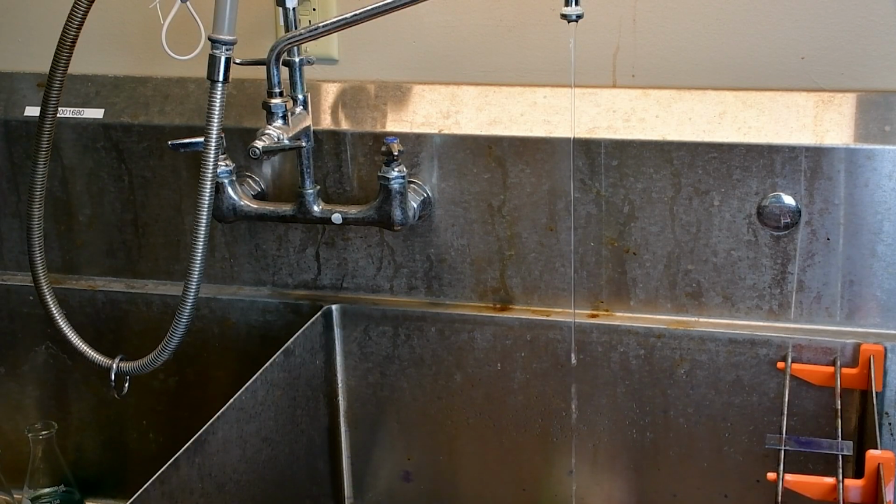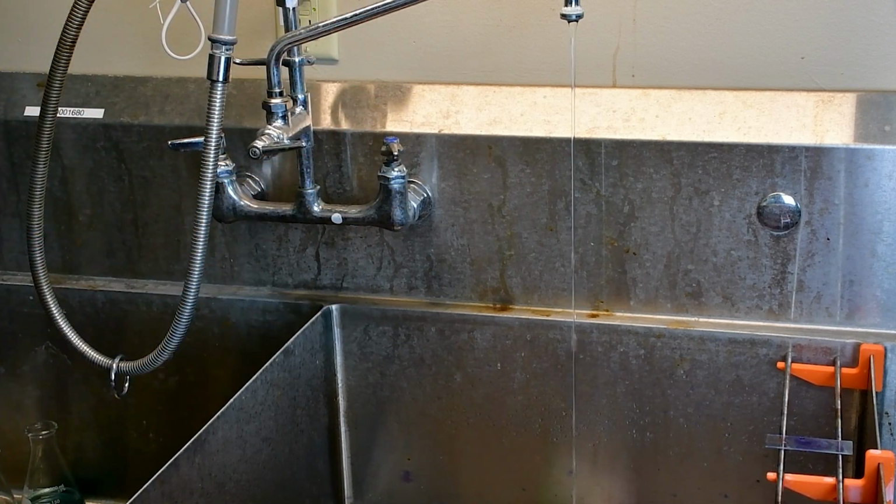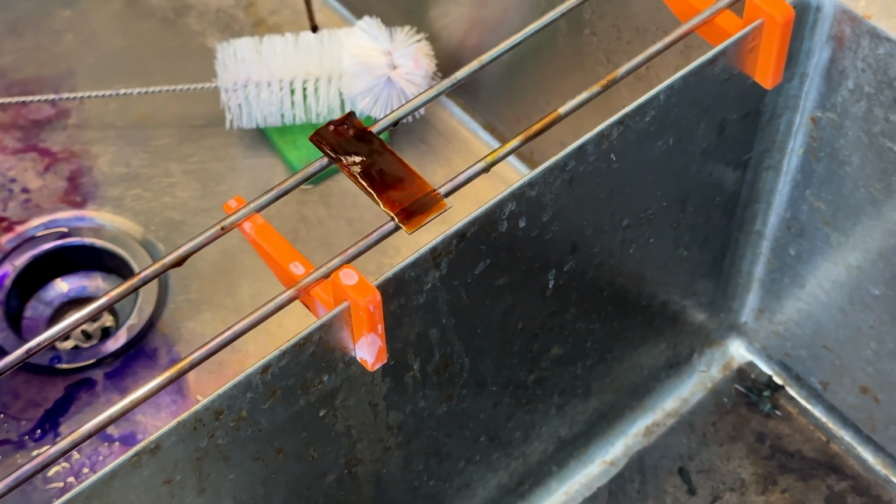Then I'm going to use the Neisser Stain 2. Now, you can purchase this. We prepare this in-house for our own use. It's fairly simple to make, but it's much simpler to just buy it in the full Neisser stain kit. I have a little bit that I've set aside into a centrifuge tube. Makes it a bit easier for just simple use. I'm going to cover the full slide again. And this is my counter stain.